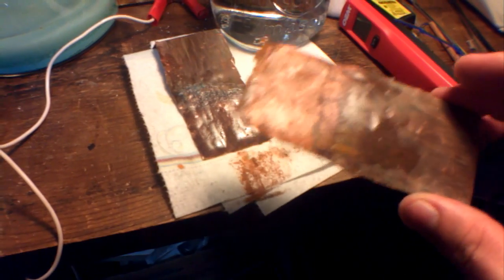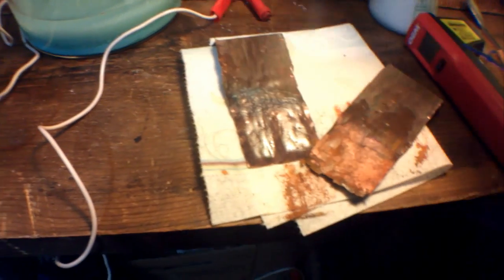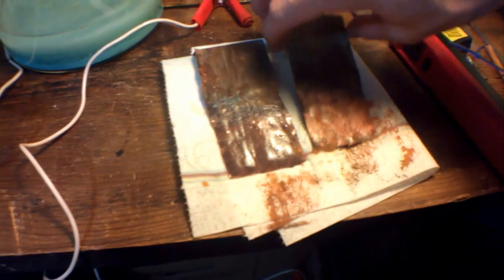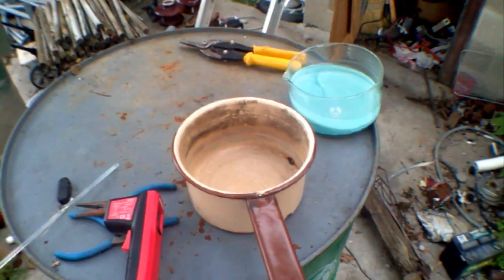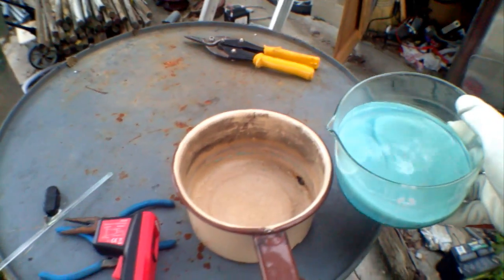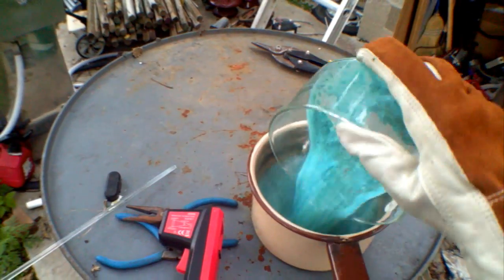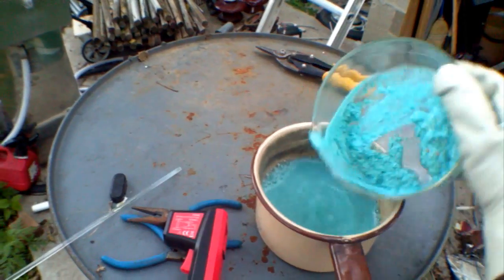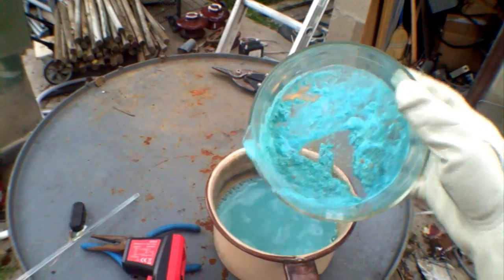You can see shiny copper underneath that sludge. Now let's deal with this stuff. We take the solution and pour it into another container. Oh, hey, look at that—lots of stuff stuck to the bottom.